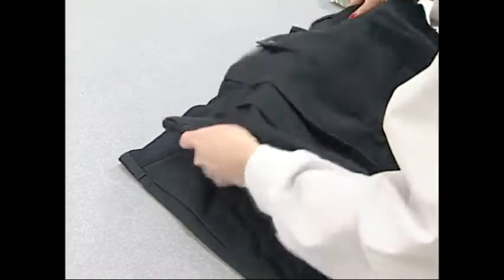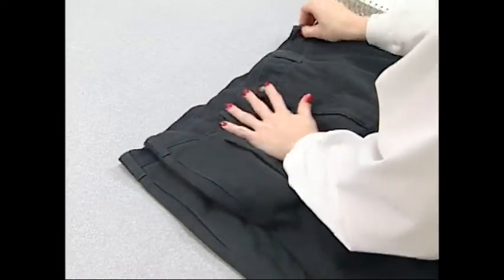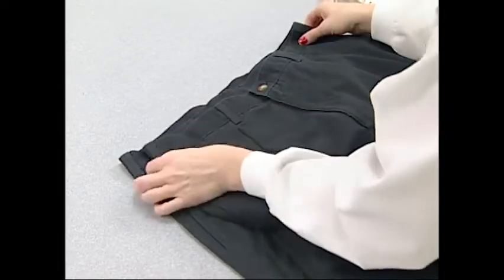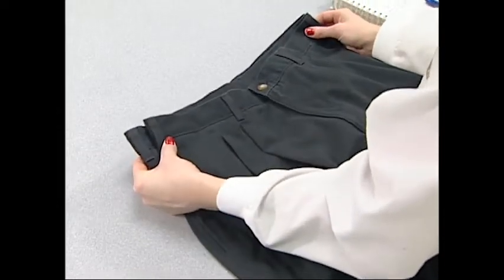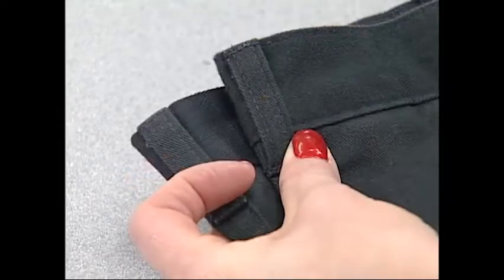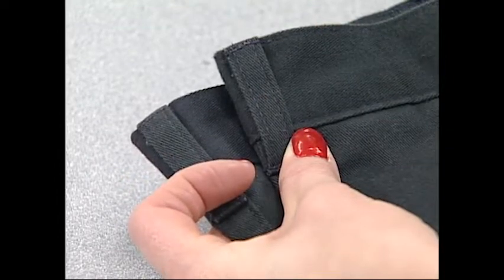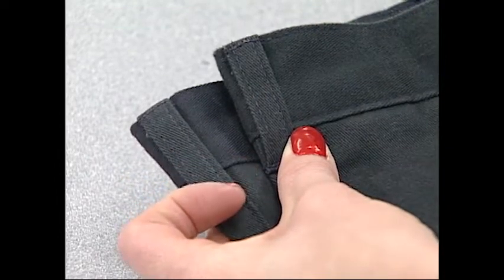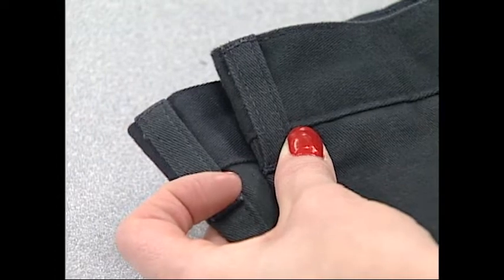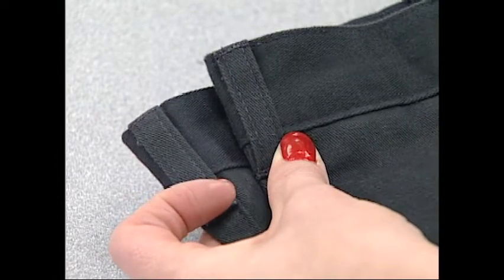One of the most important aspects of an apparel item or home product is dimensional stability to laundering. There may be no worse attribute than a shirt or slack that shrinks and no longer fits properly. Excessive dimensional instability affects appearance, fit, size, and serviceability.